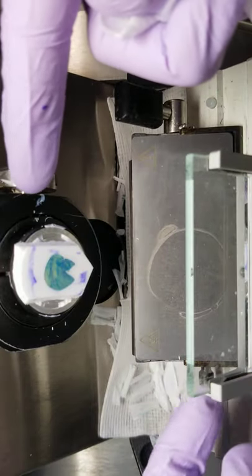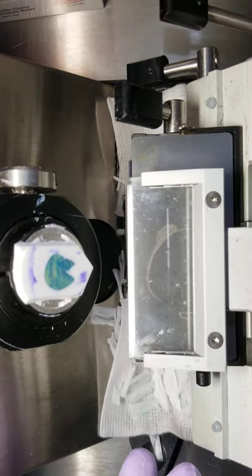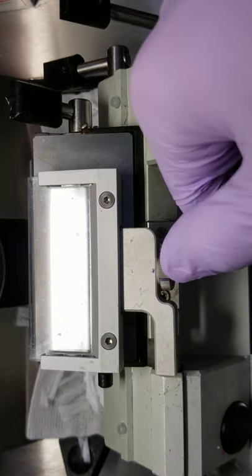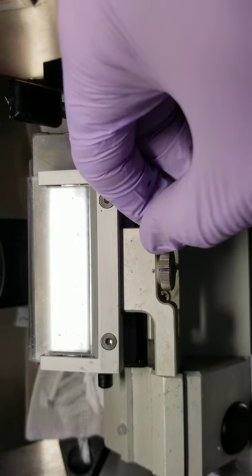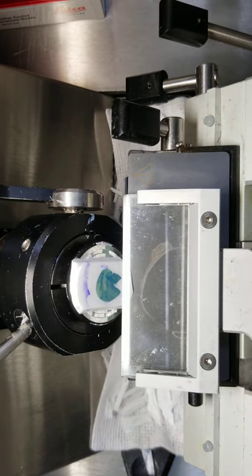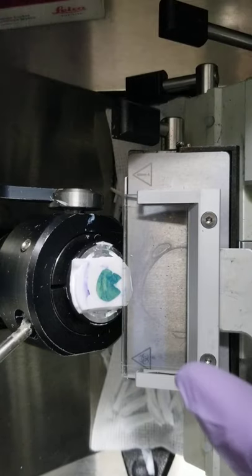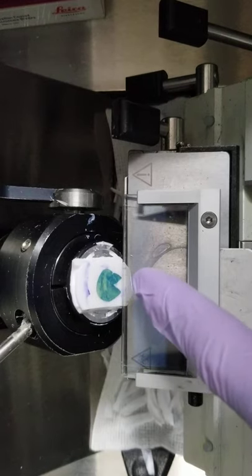Now, this isn't actually tissue, so it's not going to perform as well as actual tissue. What I usually do is leave a mark where center is, and then on the dial itself, I will put a mark for where it works best. And that glare is going to be a problem. There we go. Okay, so when it comes under, that bottom part might fold, and you always want to cut into where you've opened it up.